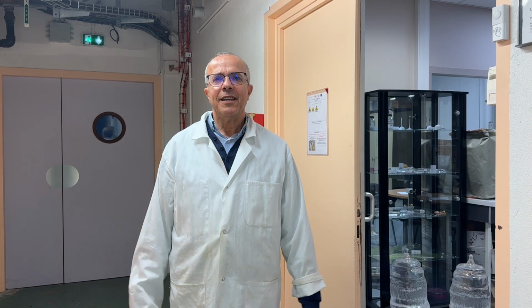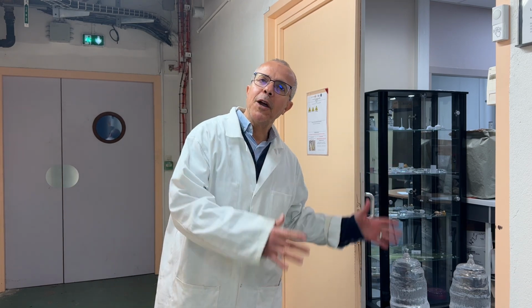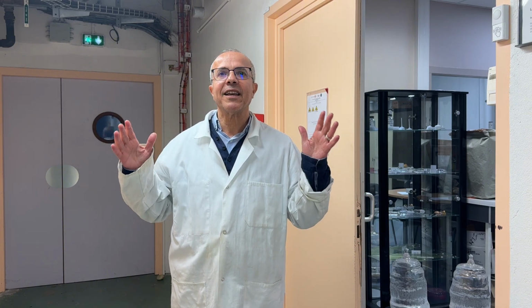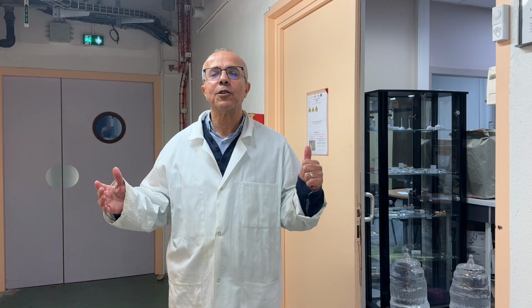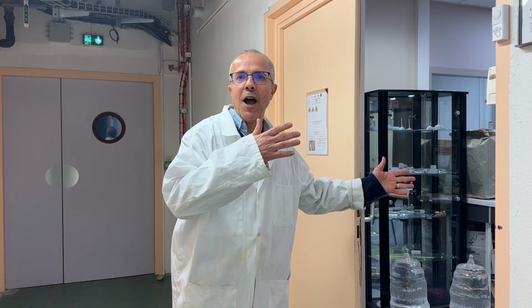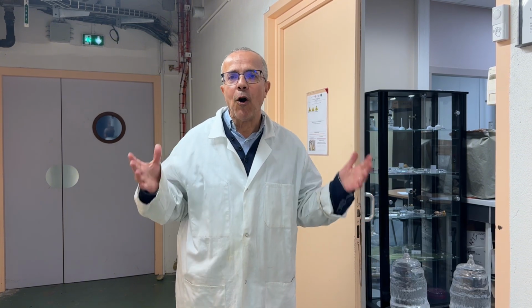So today I will introduce you to my laboratory and I will show you my activities regarding crystal growth: shaped crystal growth by micro pulling down and bulk crystal by the Czochralski technique. But I will only focus on fiber crystal growth by micro pulling down. So let's go to show you our activities, our crystals, our technology, and I hope you will enjoy this presentation.